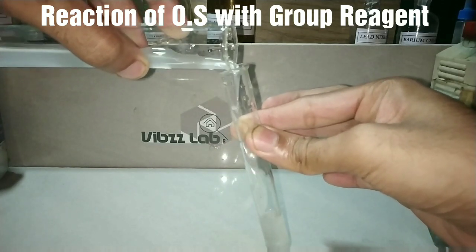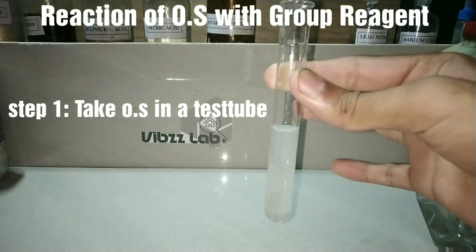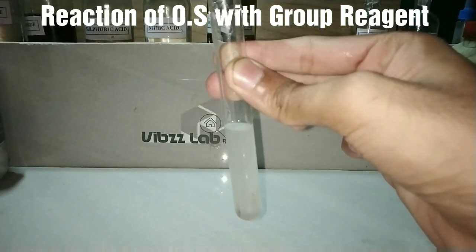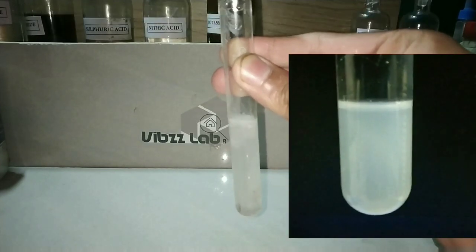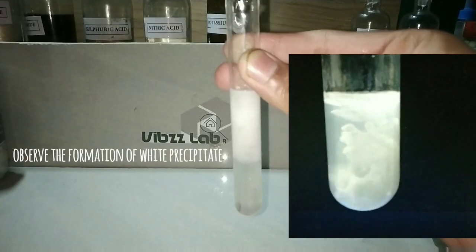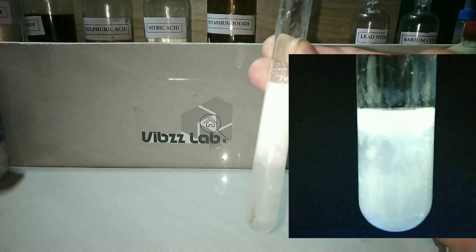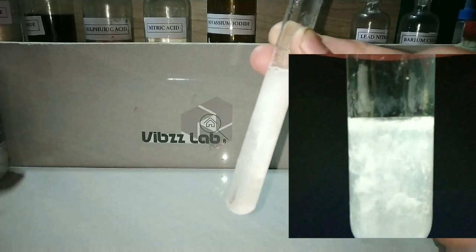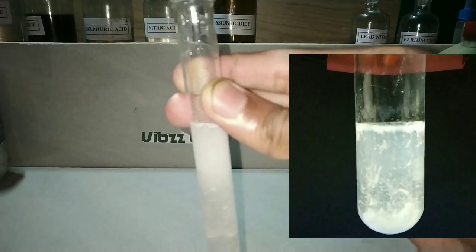The next step is to add the group reagent into the original solution. The original solution is abbreviated as OS. Step one is to take the OS in a test tube. The group reagent for group 1 is dilute hydrochloric acid. On adding the dilute hydrochloric acid, you can see the formation of a white precipitate.